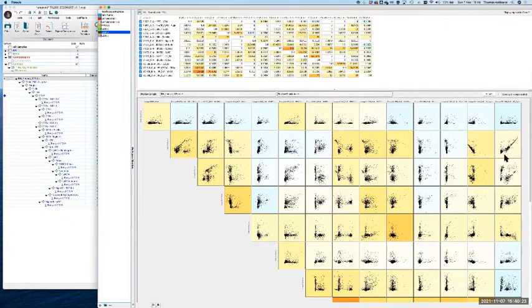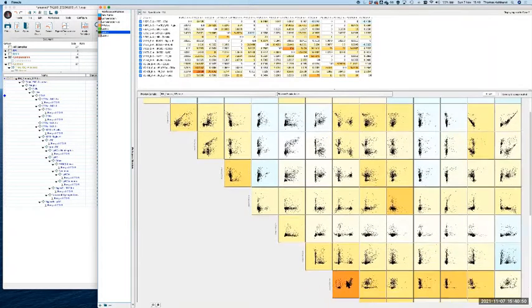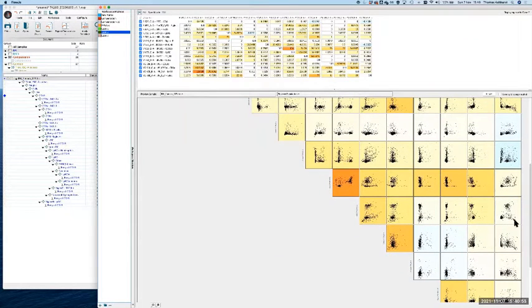Yeah. So in the violet, or the column that's pretty much in the middle there, you go and point on that and you go down. Yeah, that one. If you go down, you'll see that one looks like it's possibly overcomped a bit, that pair. And then if you scroll down and turn right, all the way down to the bottom, you turn the corner and go across for that channel. Yep, so I see what's around the corner.